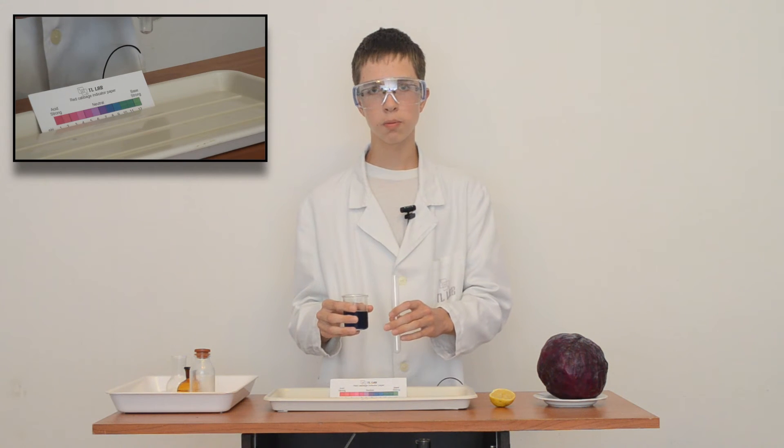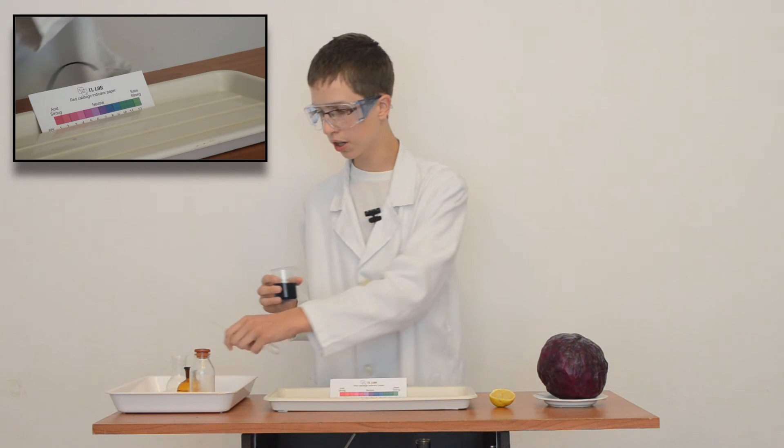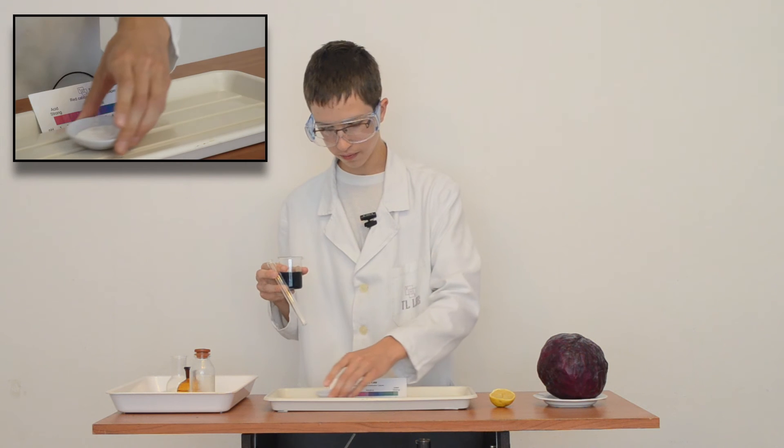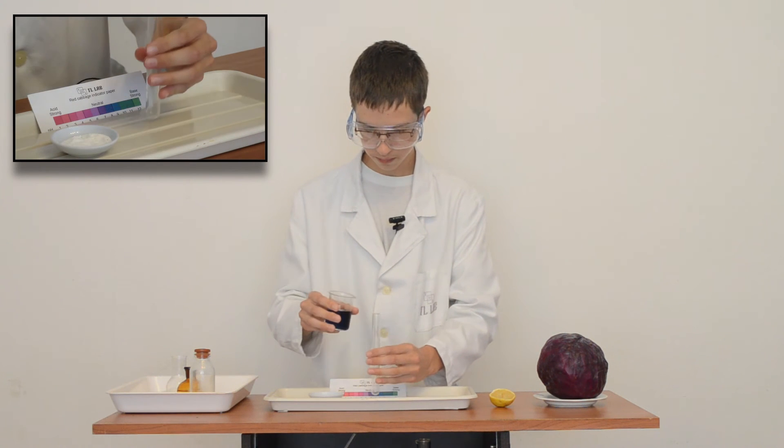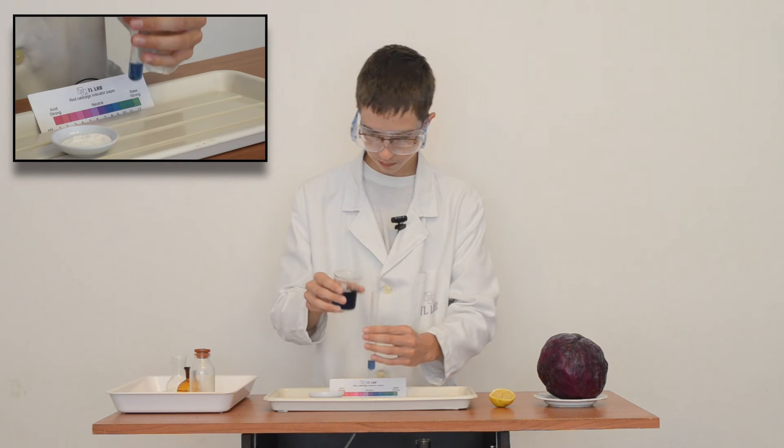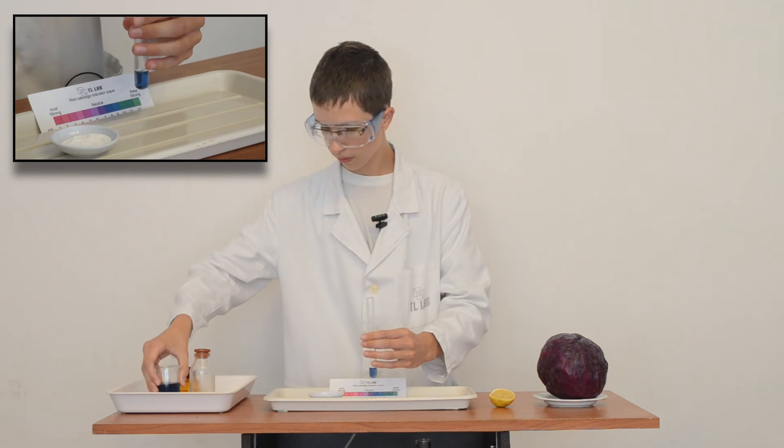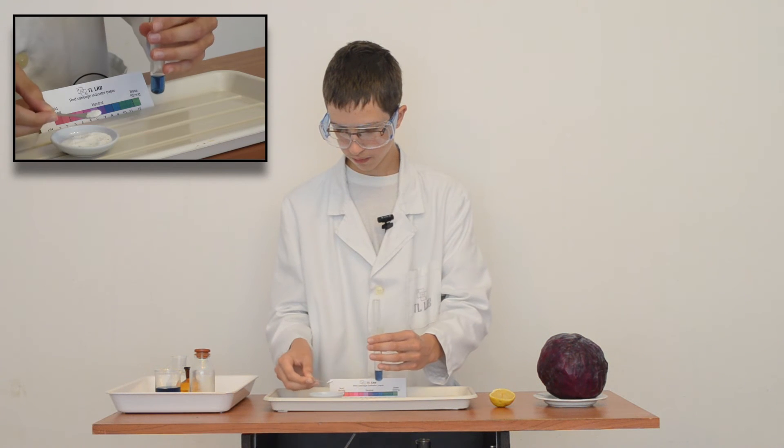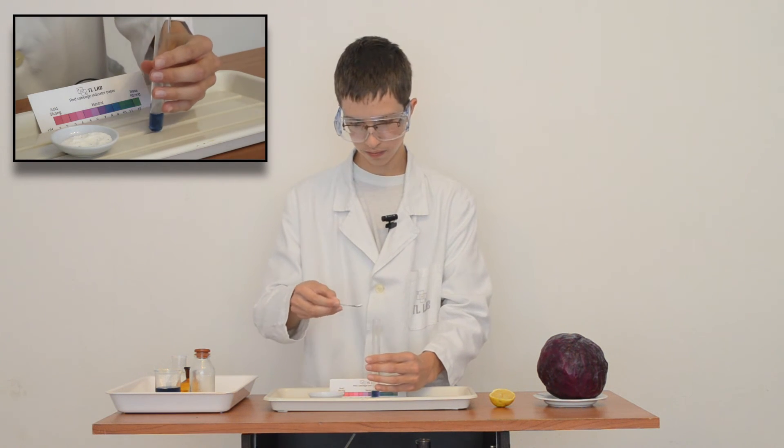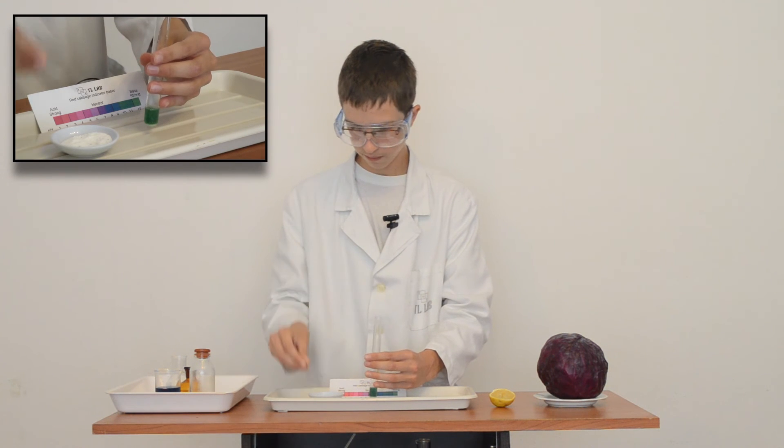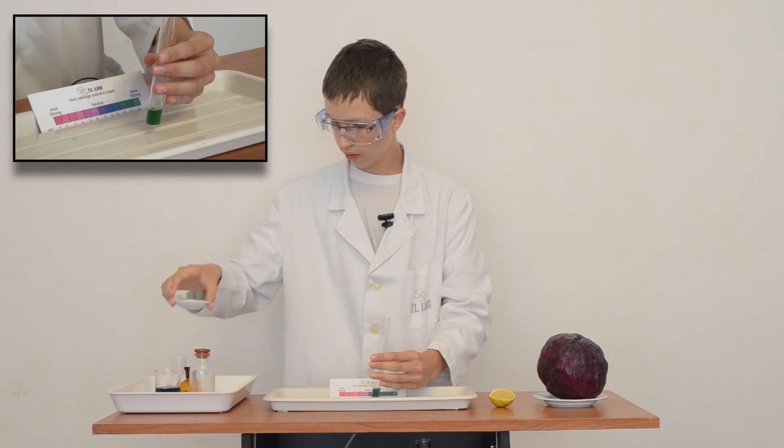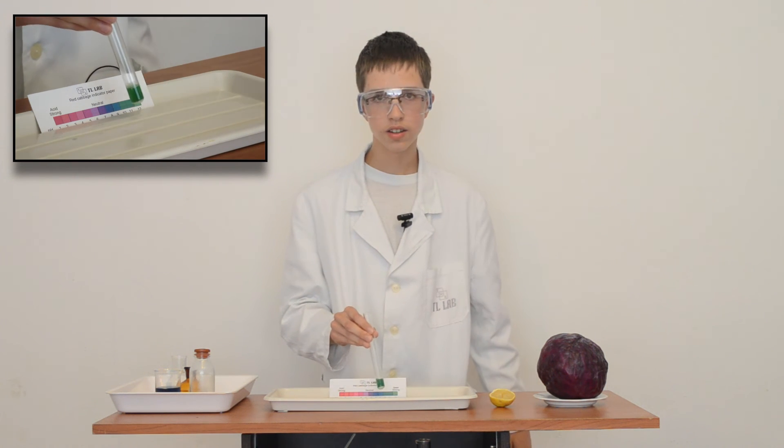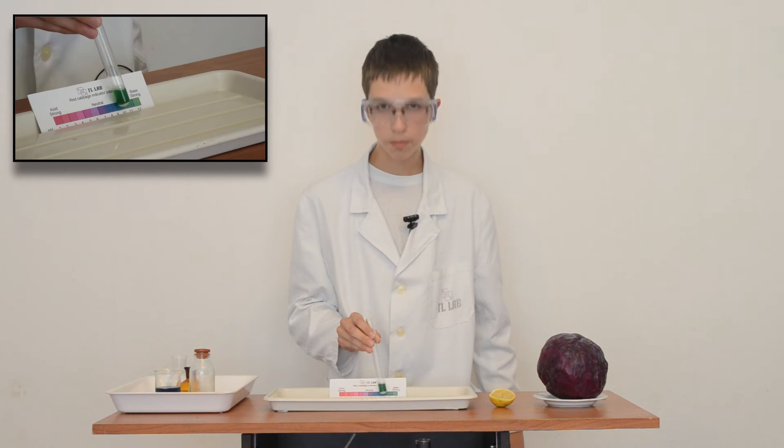First will be base, and for base we'll be using washing powder. We can see change of color, and we say that it is base.